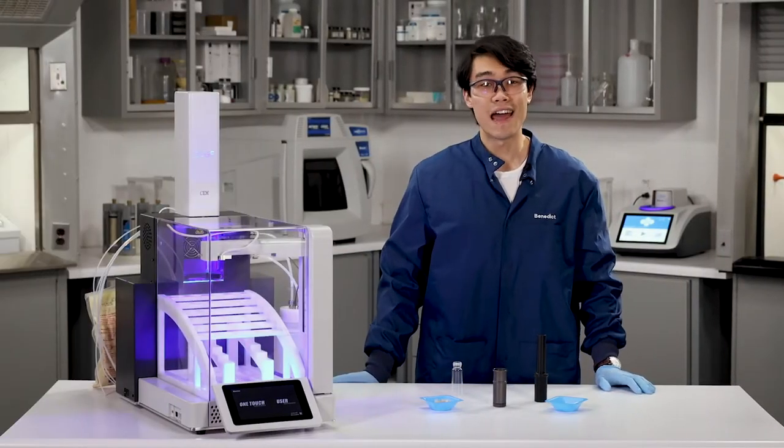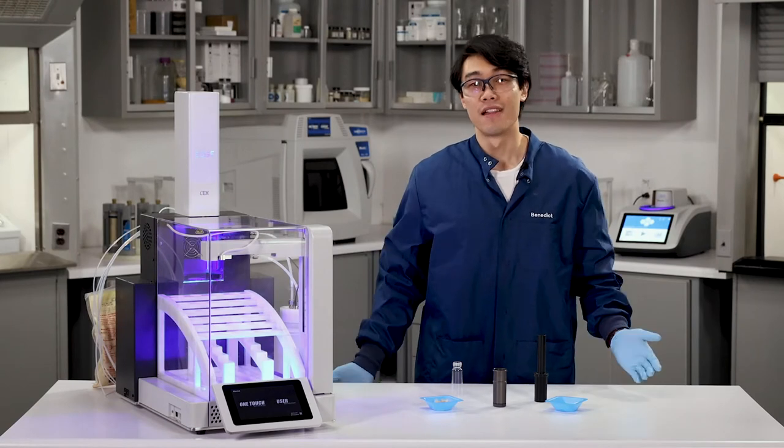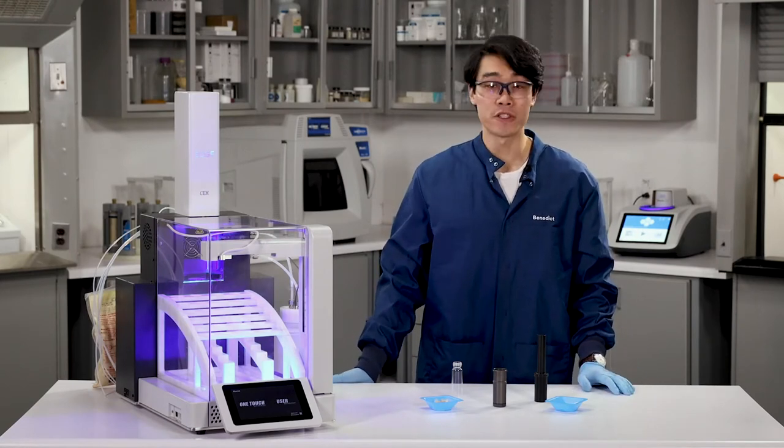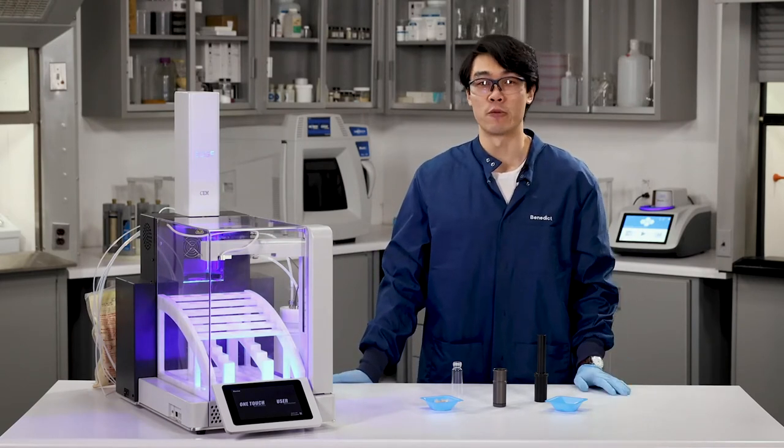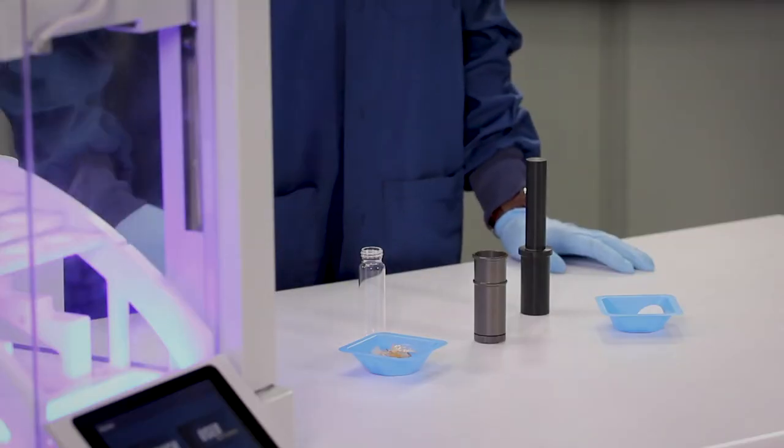So actually, right now. Now, it's time for sample prep. Like I was saying before, audience, katsuobushi undergoes some pretty interesting sample prep to go from fish to flakes.